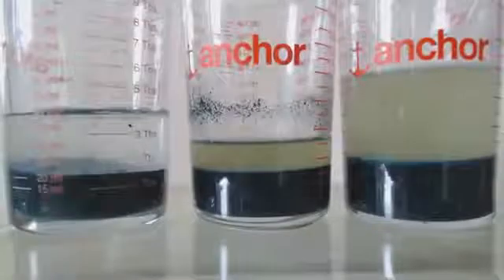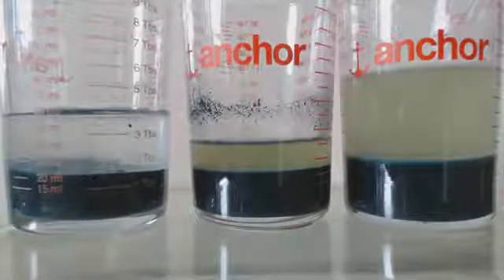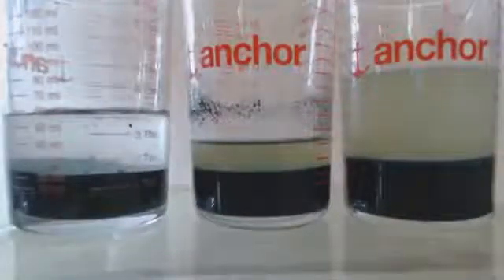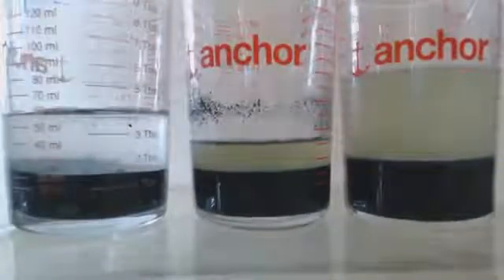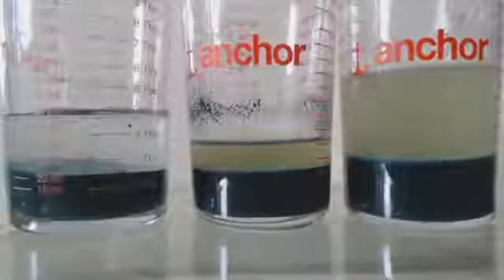So the stuff on the right, the far right, has a 10 to 1 ratio, meaning if I have a mole of chromium hydroxide in there, I put 10 moles of potassium or sodium hydroxide. So you know it's alkaline. No matter what I do, I cannot get it to dissolve. I can add another gallon of water to that, I could heat it up forever, stir it, whatever - only so much seems to dissolve.